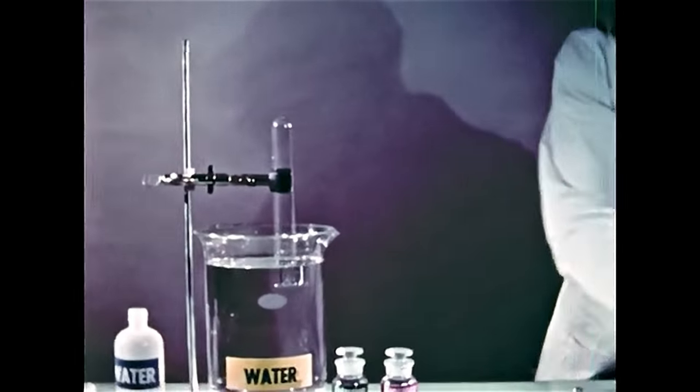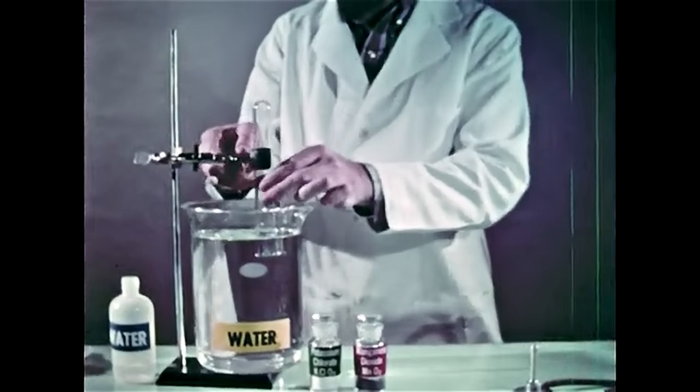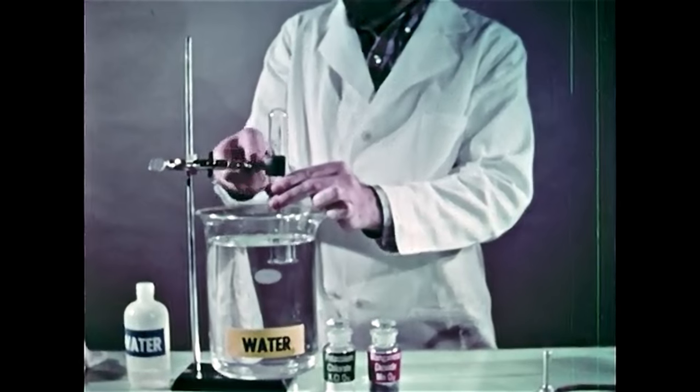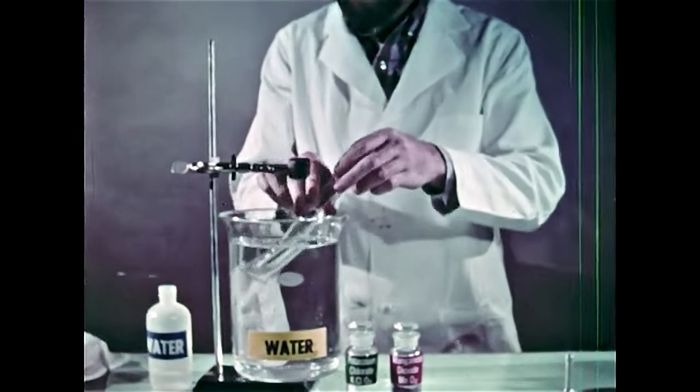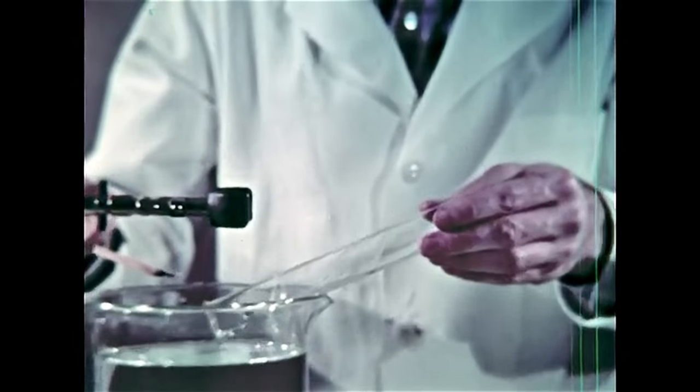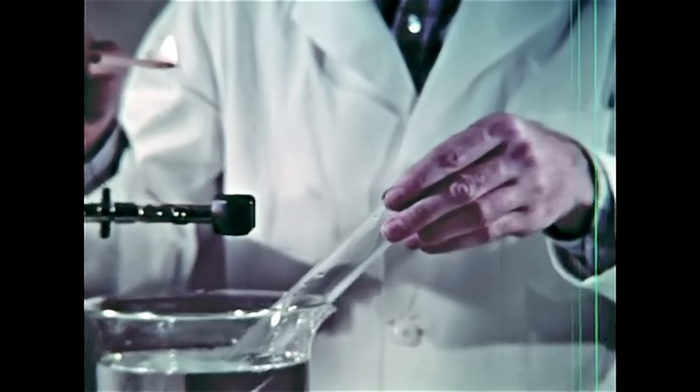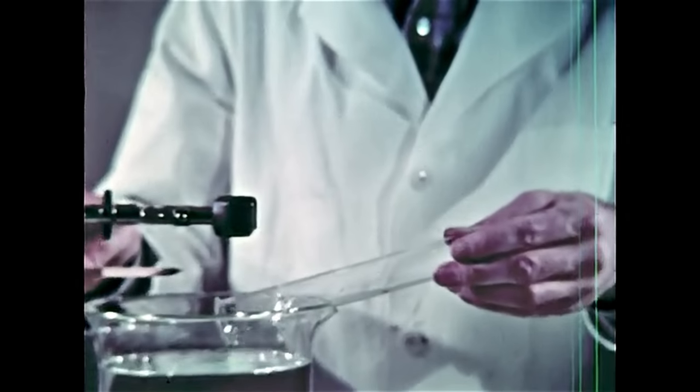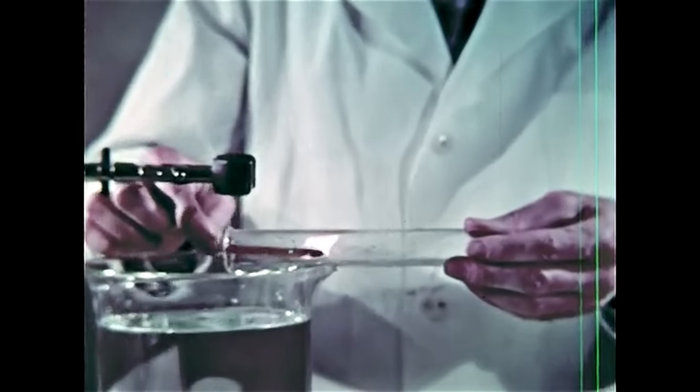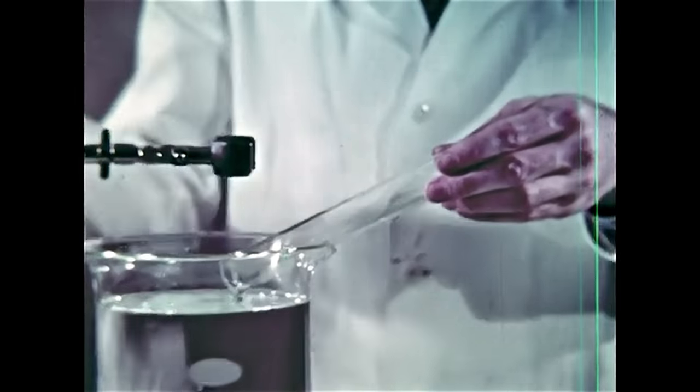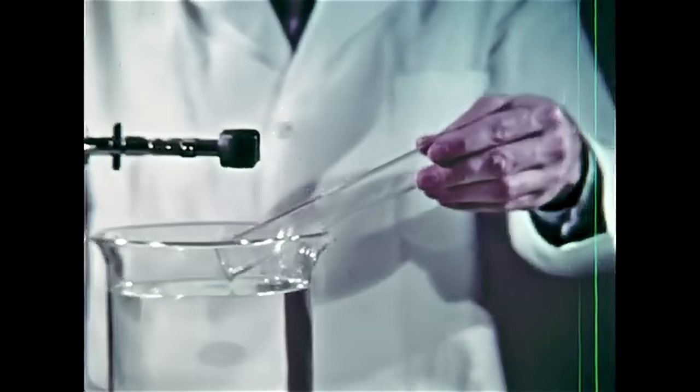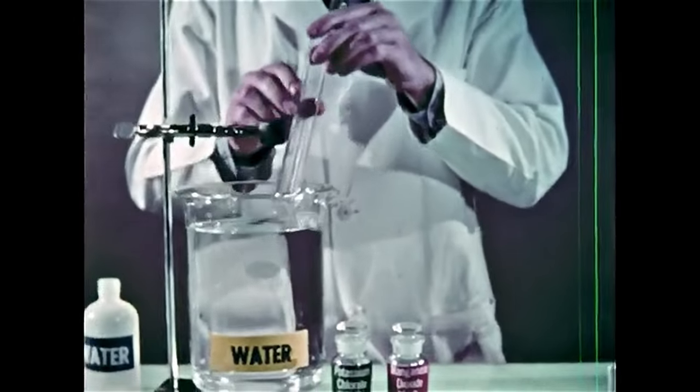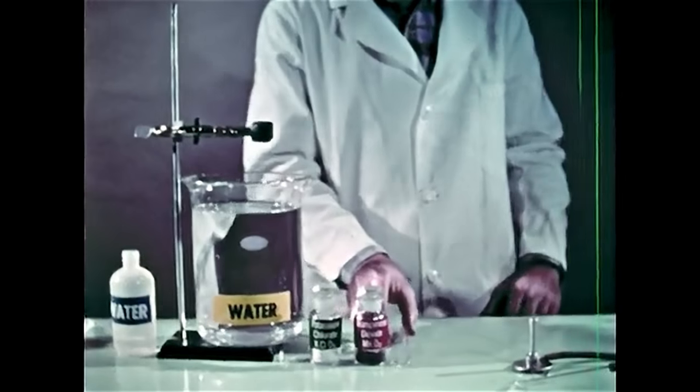The density of air is not much different from oxygen's, so no particular care has been taken to keep the oxygen in the tube during the combustion test. We're using the same test in all of these experiments for consistency and because it's adequate for these controlled conditions. But an exclusive and significant proof would require a series of tests based on a more detailed knowledge of oxygen's properties.